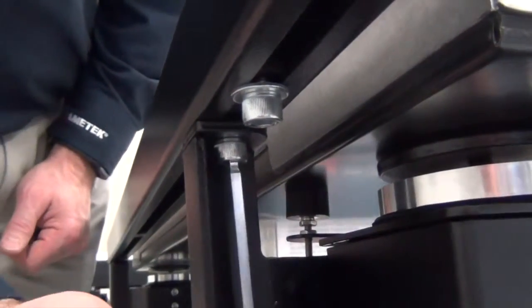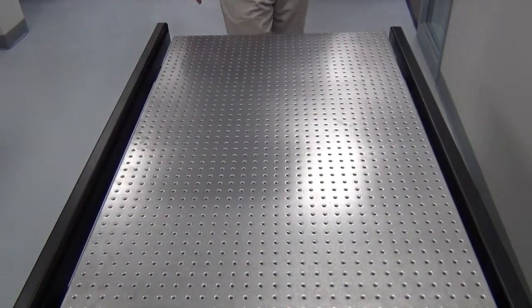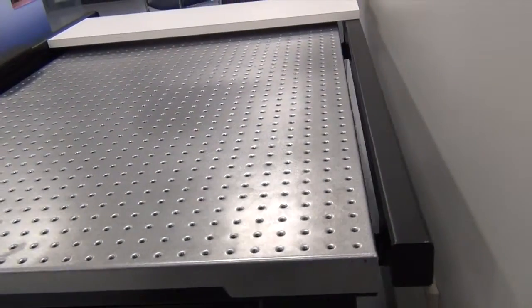Once the bars are assembled to the clean bench, confirm the top is placed square and there's no interference with the isolated work surface.